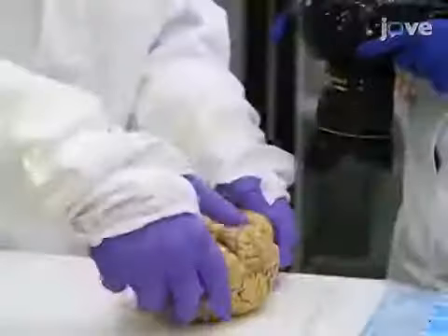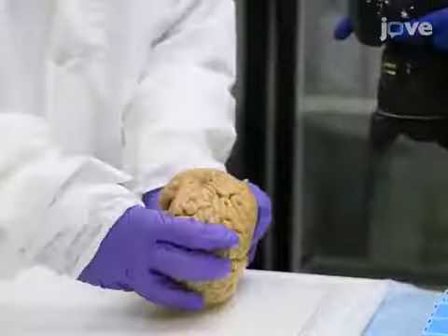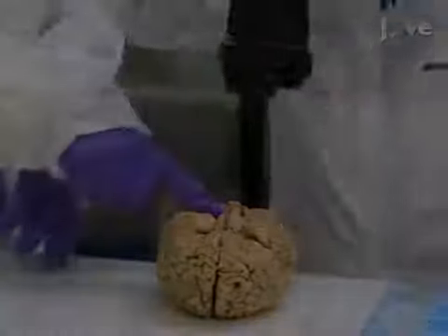With the frontal poles oriented away from the investigator and the superficial aspects of the hemispheres facing the investigator, take as many digital pictures as necessary to document possible macro anomalies and to account for possible clinic neuroanatomical and post-cutting considerations.